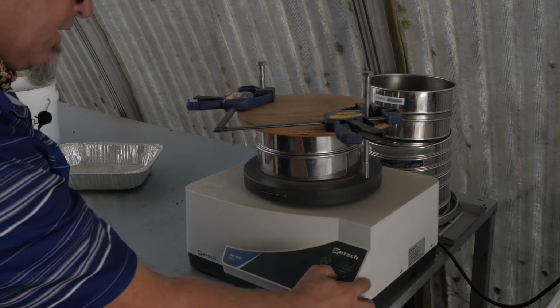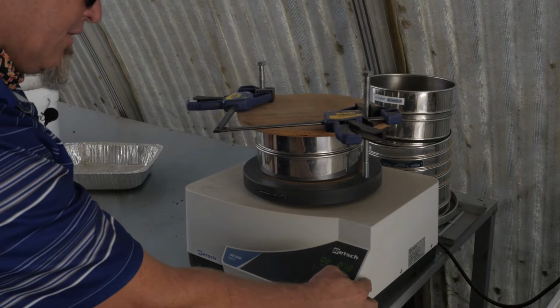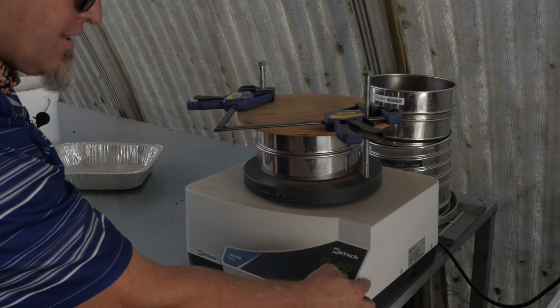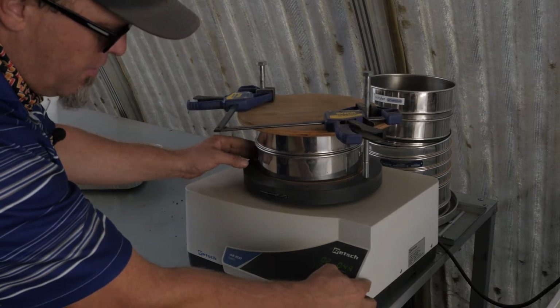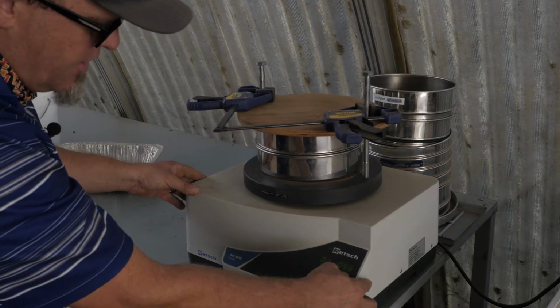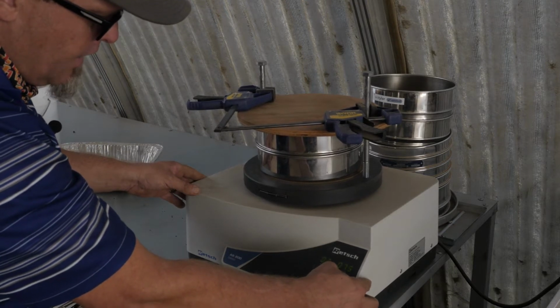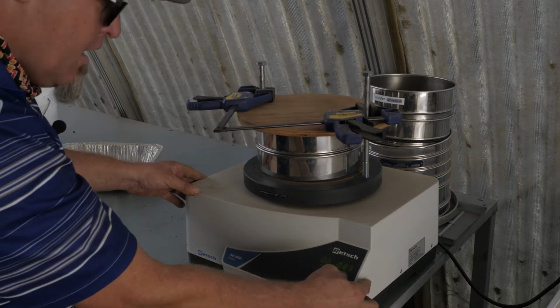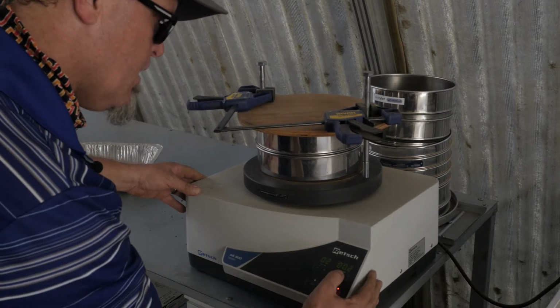Oh, that thing's super low. Somebody had it turned down to 0. Let's watch it cross the amplitudes. It's starting to move a little bit more vigorously. Wow, this thing's poking along right now. Usually it blows up. Why is this thing not? There's your time lapse. Huh, that's crazy.